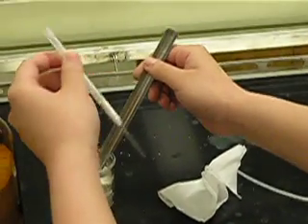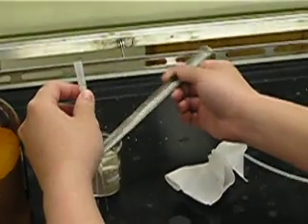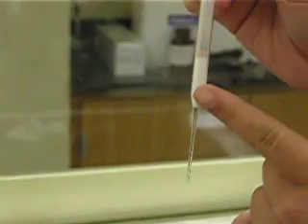Don't worry if you accidentally put too much sand in here, because it won't harm your procedure or lab experiment at all. As you can see, there's my silica and that's my sand level.